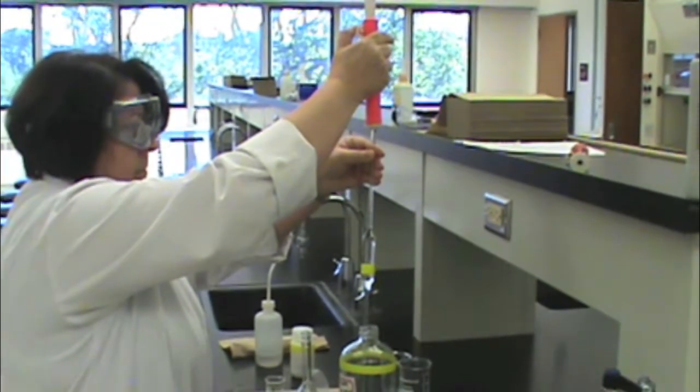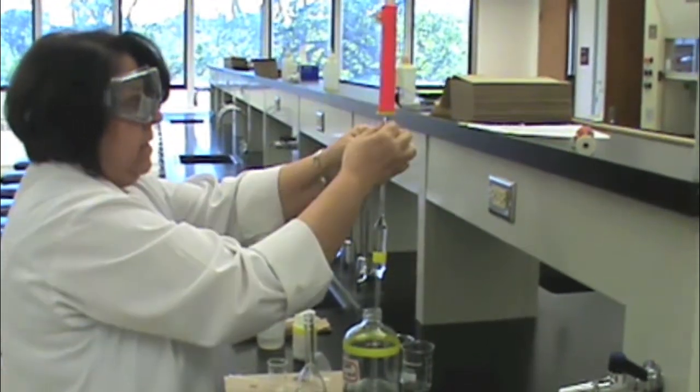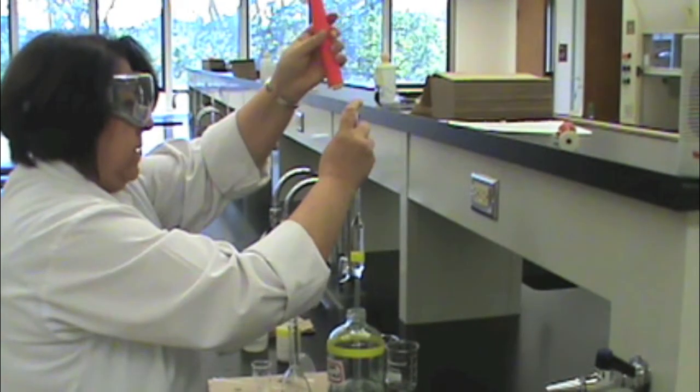Now you need to remove the pipette filler, so place the pipette against the bottom of the container. Get your index finger ready, remove the pipette filler, and place your index finger over the top of the pipette.